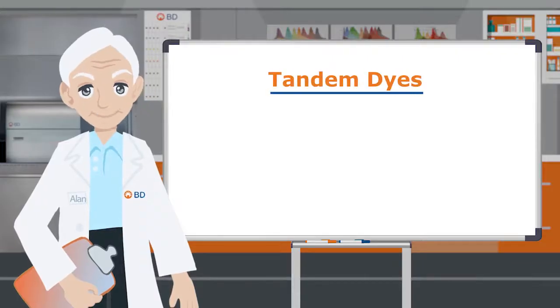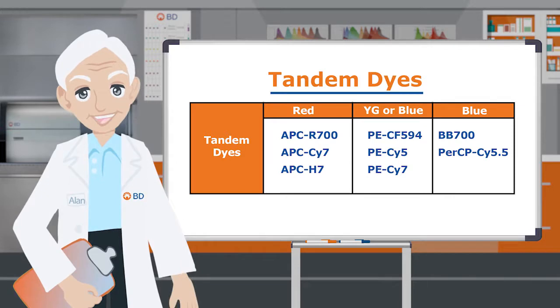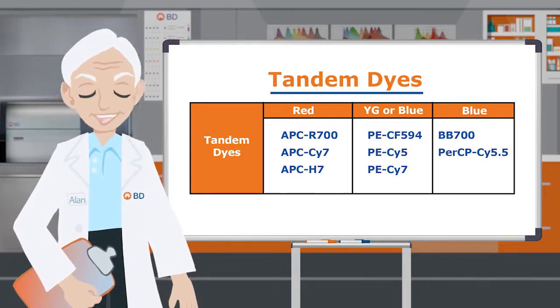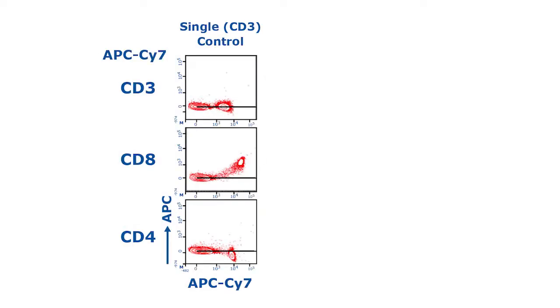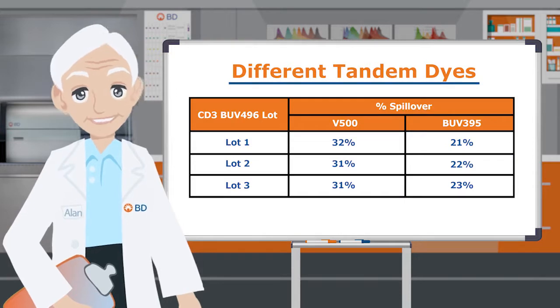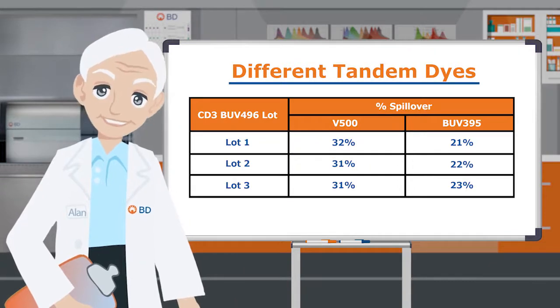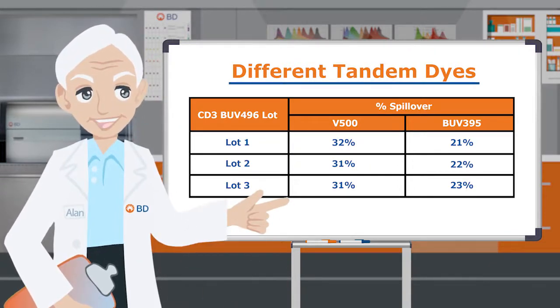The second related principle pertains to tandem dyes, such as PE-Cy7 and APC-Cy7, for which spillover properties may change when the same tandem dye is conjugated to different markers. In this example, the spillover values, calculated using the CD3 APC-Cy7 single stain control, are not accurate for the CD8 or CD4 APC-Cy7. In these cases, it's important to use reagent-specific compensation controls as shown in the right column. Similarly, when different lots of the tandem dye are conjugated to the same marker, you can also have different spillover values. In these cases, lot-specific controls should be used to accurately calculate compensation.